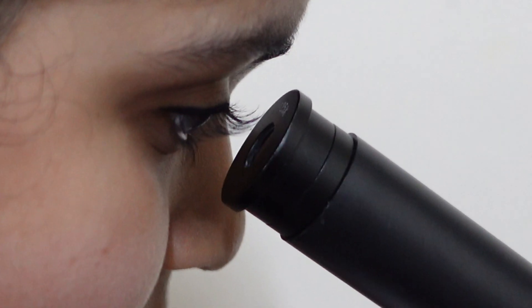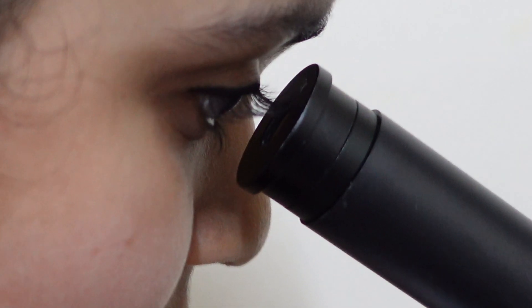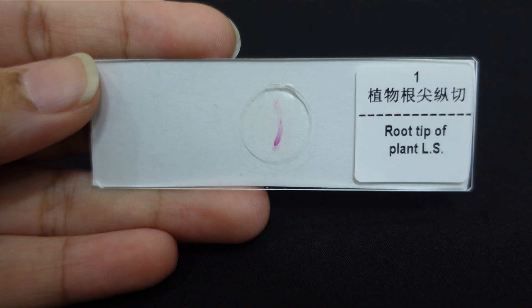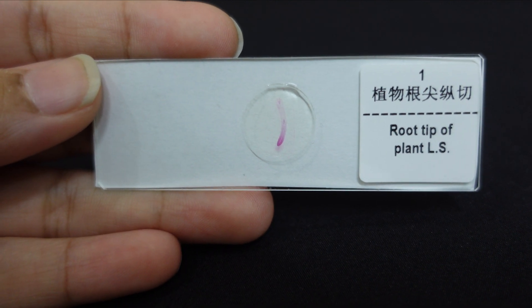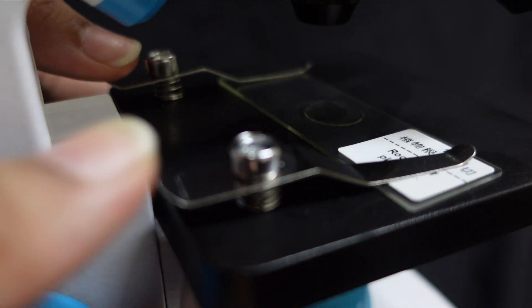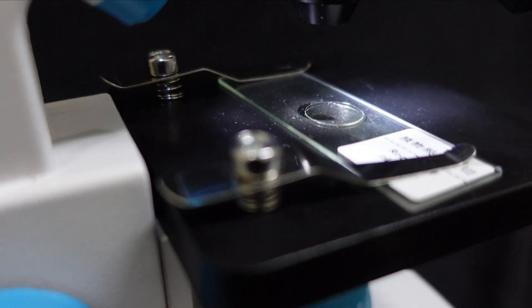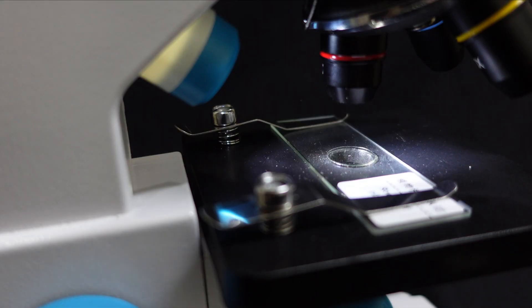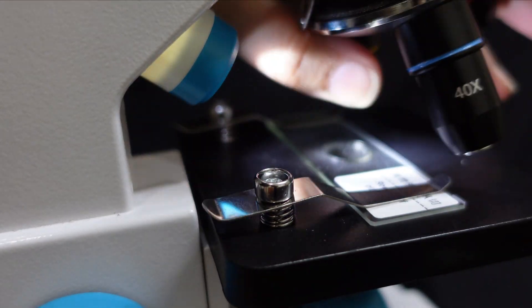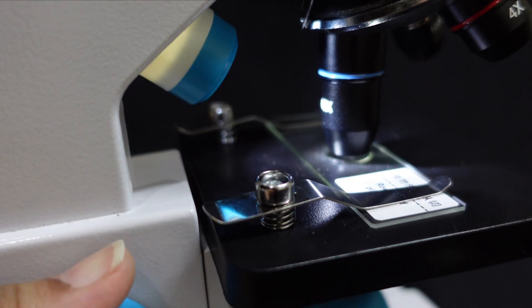The first slide we're going to see is the longitudinal section of a root tip of an adult plant. Here I'm getting ready this stage. I'm going through each of the magnification objective lenses one at a time and spinning the coarse focus knob, making sure the slides are clearly seen.